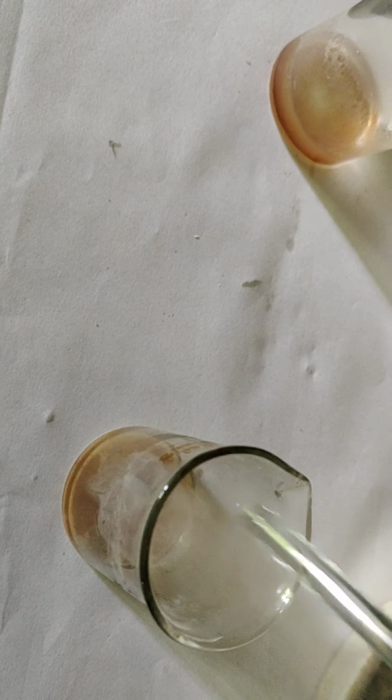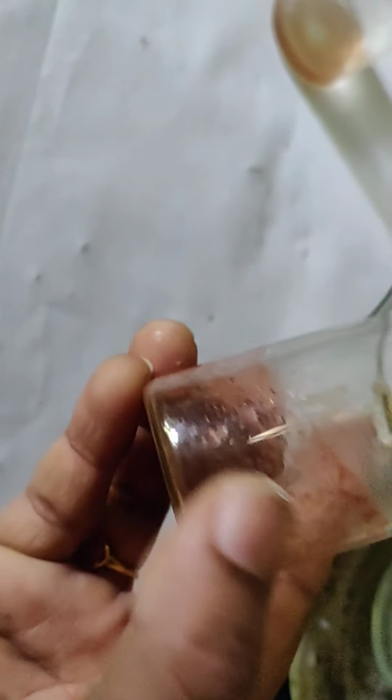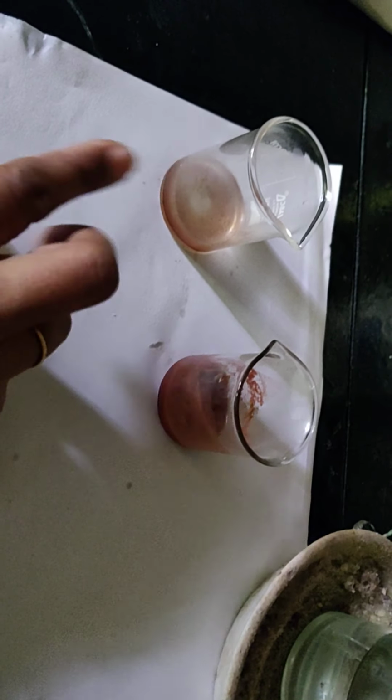I just need to neutralize it. See, as I go on neutralizing, I'm going to get back phenol. This can be filtered and it can be used. So we have separated it and we can even analyze the given compound. For this one I've just got to evaporate the ether. I get back aniline. This is how we use solvent extraction for a solid liquid mixture.